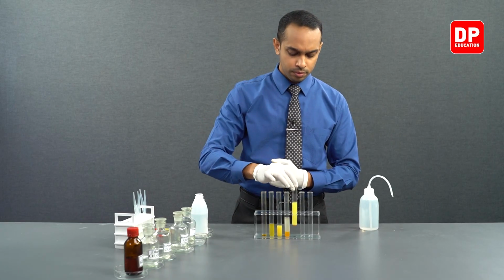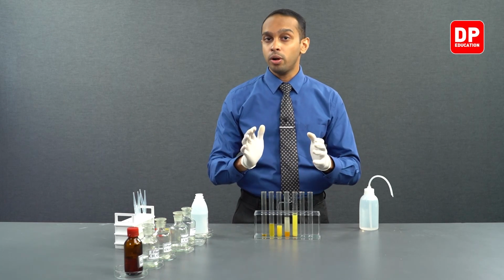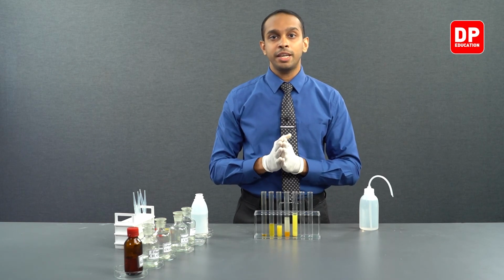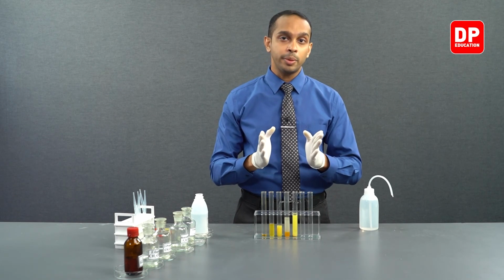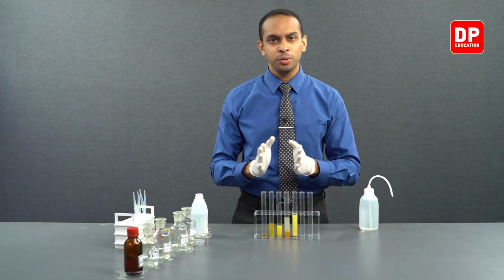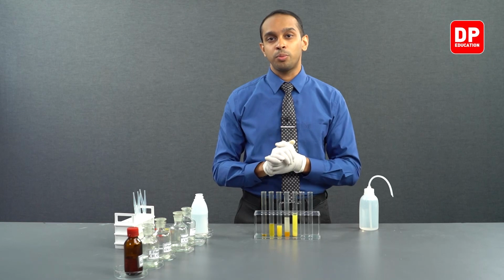So finally, you have to make the observation that upon addition of 2,4-DNP, all the aldehydes and ketones will answer positively, as long as we are reacting 2,4-DNP with the carbonyl compounds. All the carbonyl compounds, regardless of whether they are aliphatic or aromatic, will answer positively to the 2,4-DNP test. Let's move on to the reactions of aldehydes and ketones that you see with potassium dichromate.